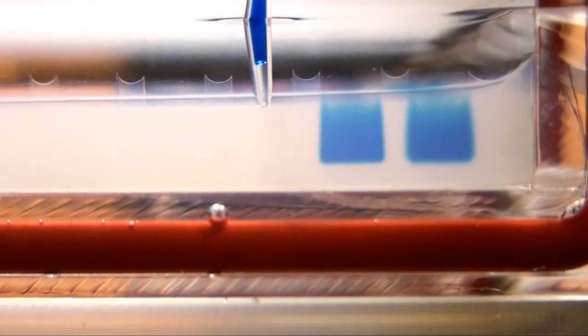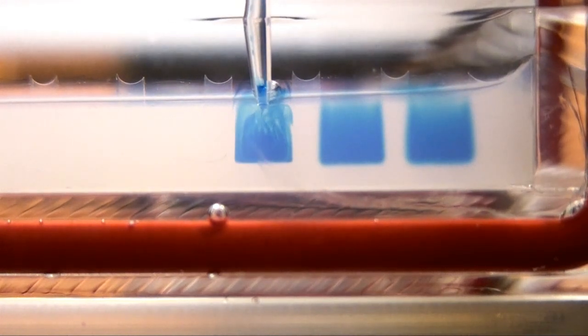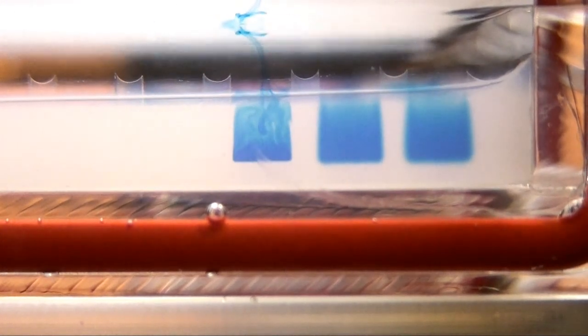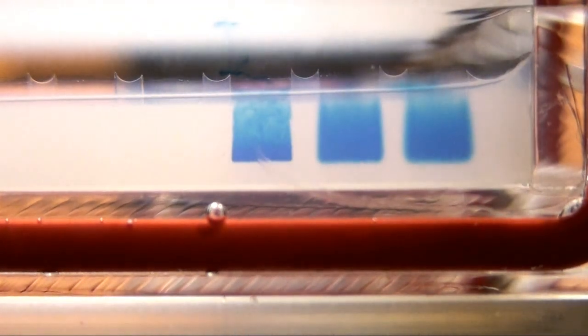The next couple examples are your classic air bubbles. The first one is the air bubble at the tip. This is usually no problem. Just before you put it into the electrophoresis buffer, depress your plunger to get rid of it.